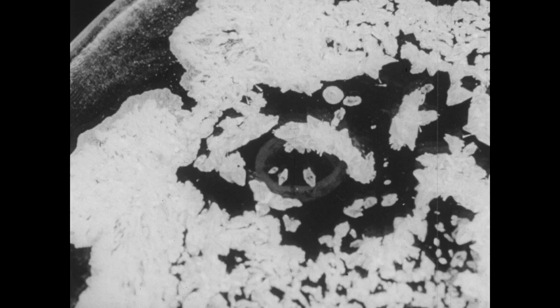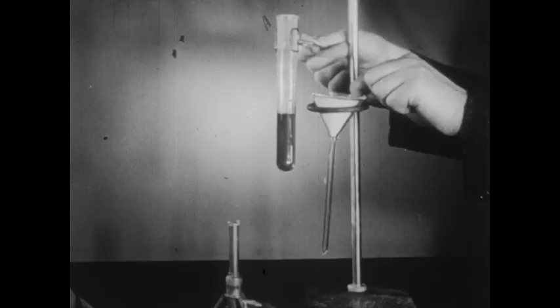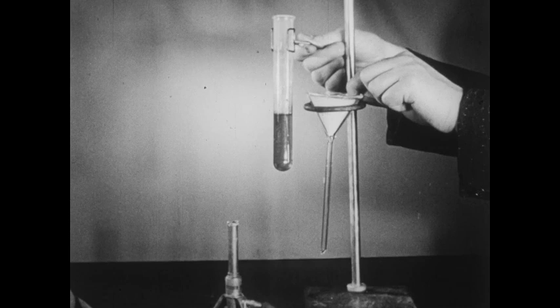Filtering the solution, and then permitting the carbon disulfide to evaporate on a watch glass. The two or three small crystals in the red circle illustrate the rhombic form of sulfur quite clearly.